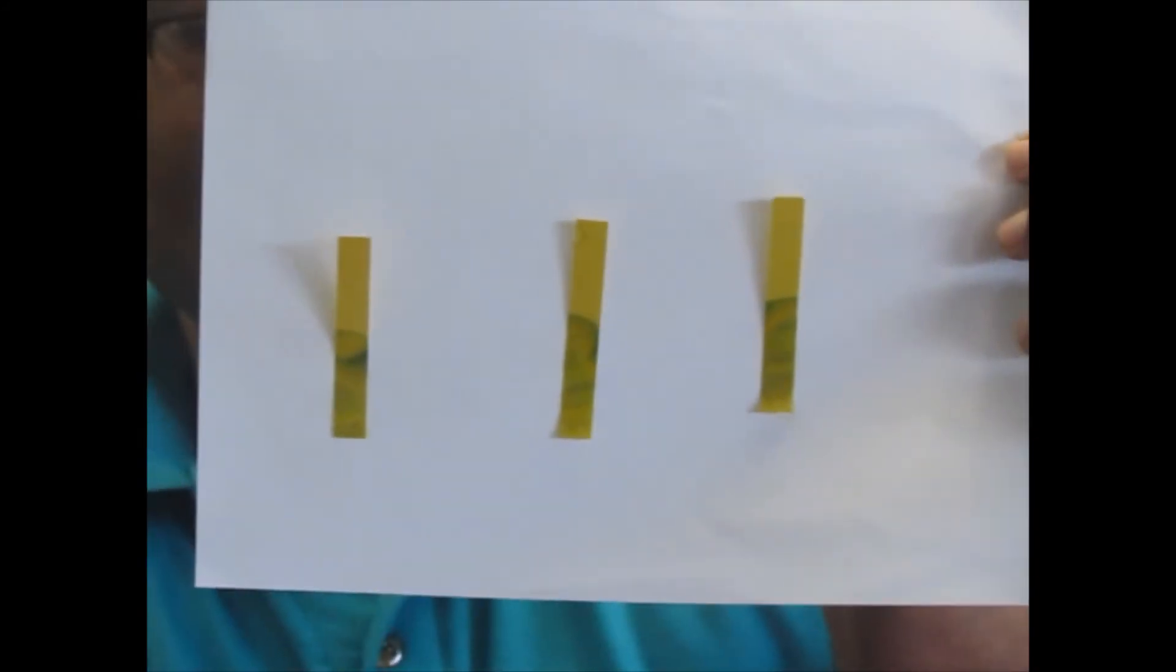As you can see, the colors of the samples have not varied much. And this could be because of the error of the litmus paper.